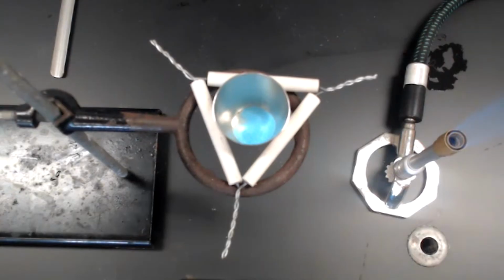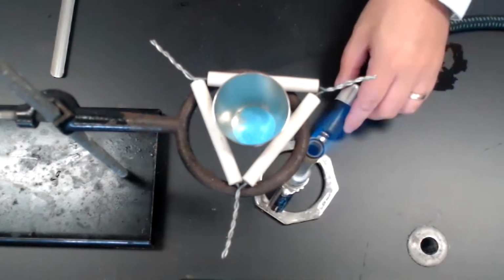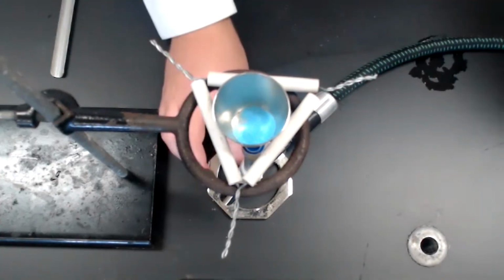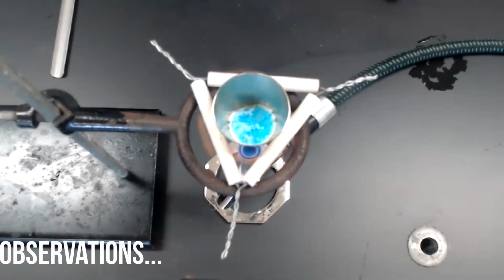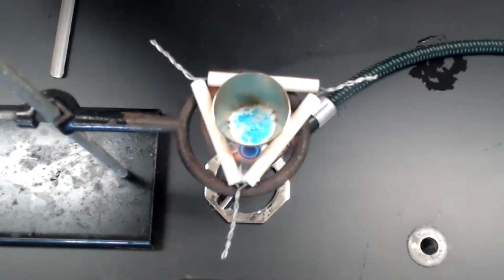Notice this time, because we are not heating a liquid, we don't have to worry about covering the top. In fact, we want to leave it uncovered so that you can observe the reaction. You will notice the sample is beginning to become white. So the copper sulfate pentahydrate sample, which was initially blue, is slowly turning into a white powder.